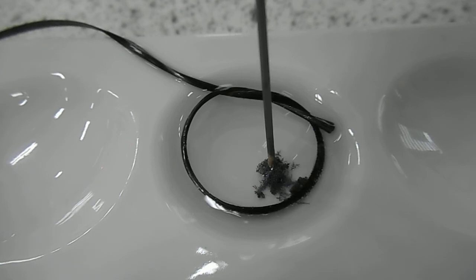We've got a colorless gas produced at the anode which is oxygen gas and a nice pattern in the formation of the lead metal there.